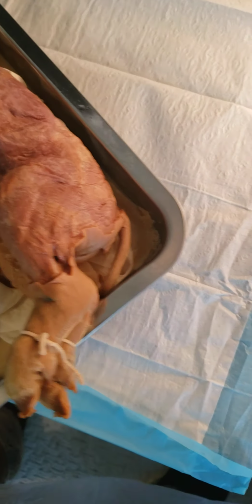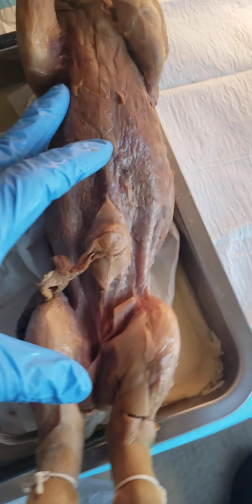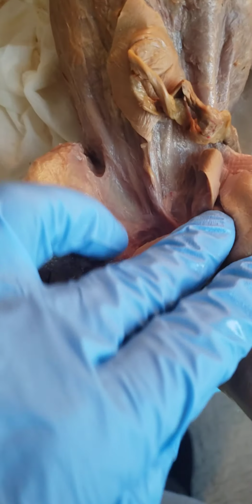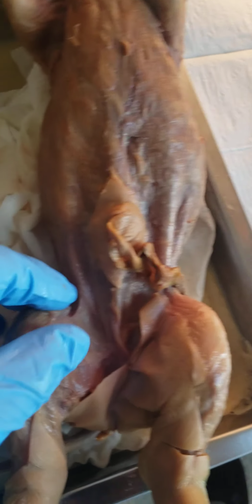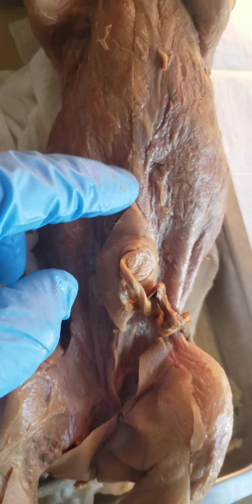So that's going to be on the underbelly of the pig. This was definitely the region I had the most difficulty in skinning. But your rectus abdominis, basically your abdominal rectus muscles, is going to be right here in this region, running along the underbelly of the pig right down in here. You can kind of see the slight striations right there and up here. Awesome.